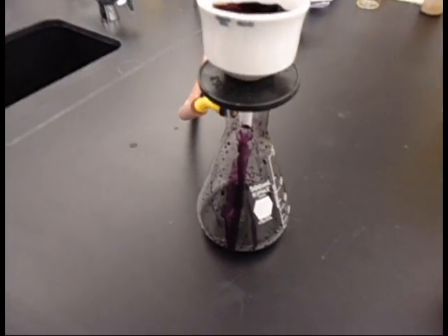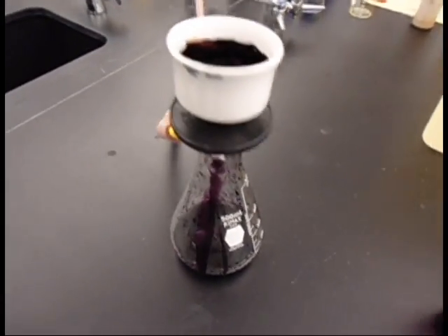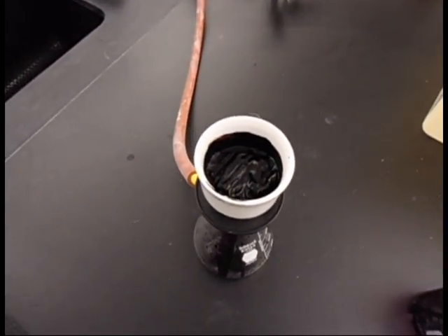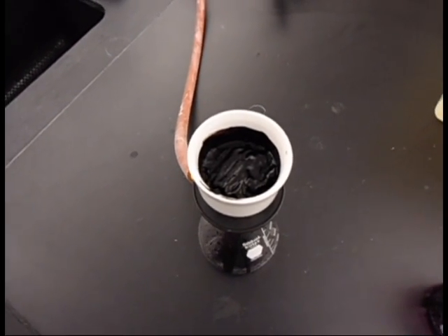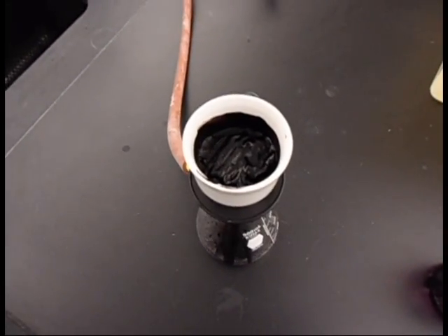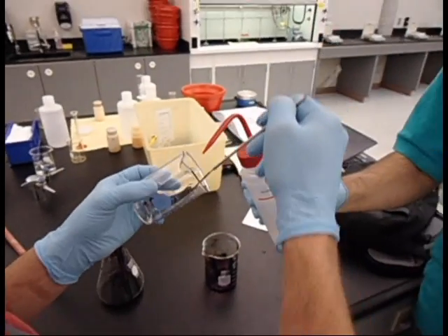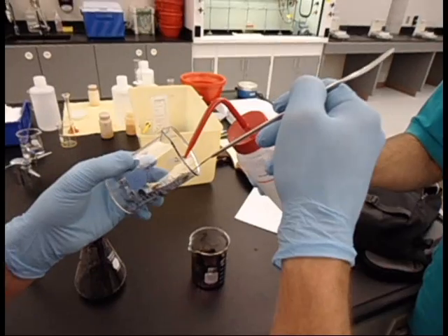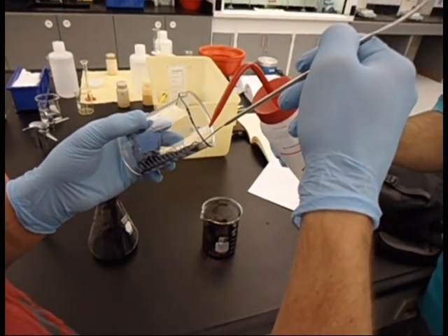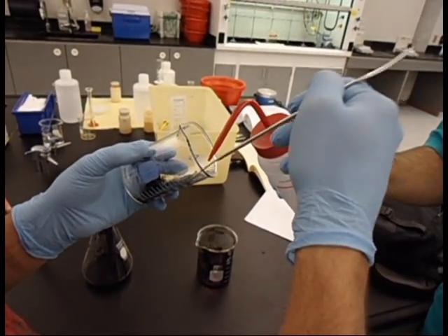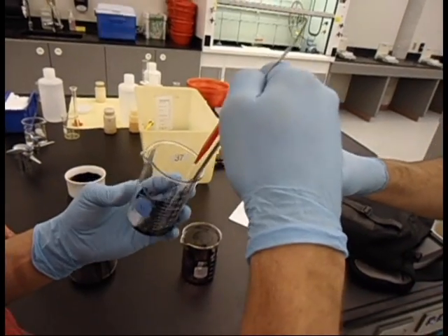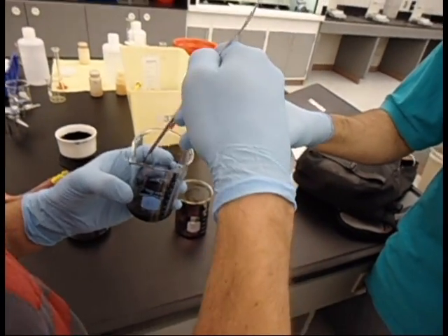About three or four minutes later, we've got a nice gummy dye paste left over. It's not quite done, but it's the basic idea. We're just mixing some of the dye filtrate with acetone. We're going to show a fun property where we can change the color of the dye with an acid or a base from one color to the next.